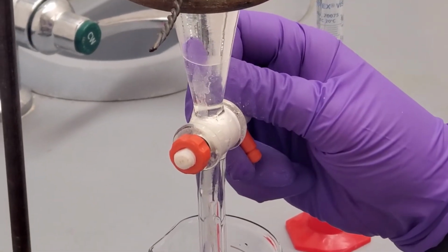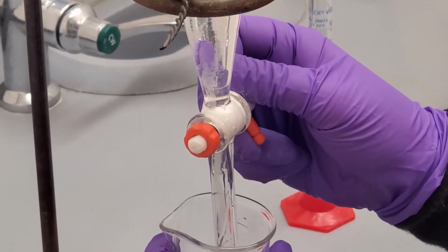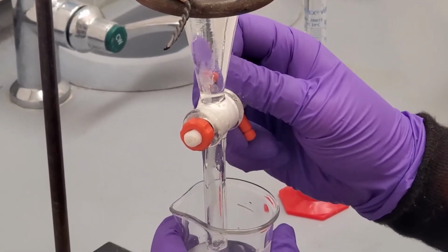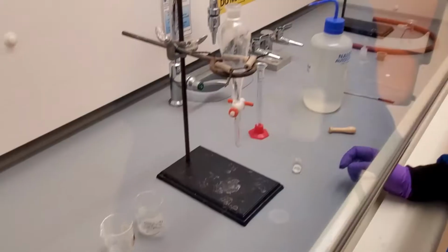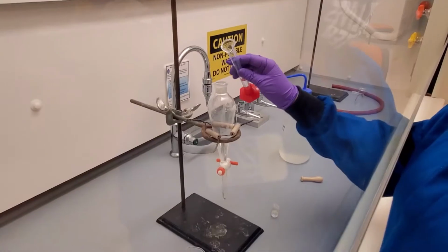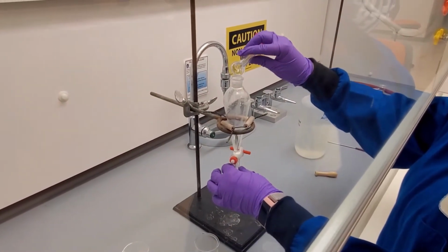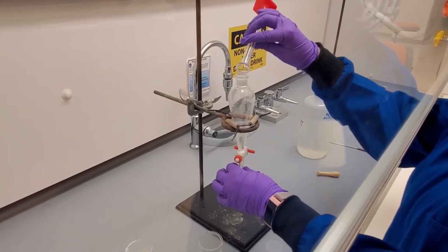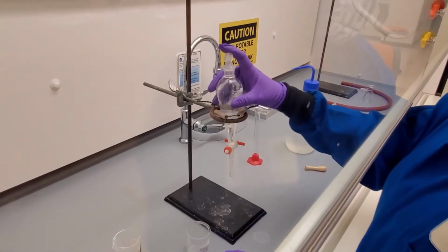However, leaving a tiny portion of the aqueous layer behind in the ethereal layer is okay, as we will be adding 4 ml of DI water to it momentarily. Again, move the aqueous layer beaker out of the way and add 4 ml of DI water to the ethereal layer. This will remove any remaining salicylic acid and bicarb salt from the ethereal layer. We will shake and vent.